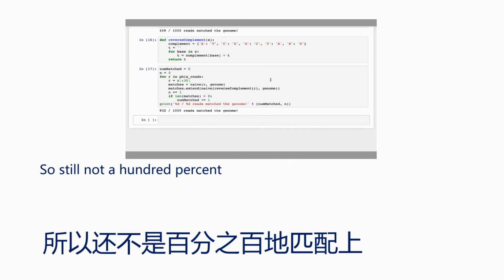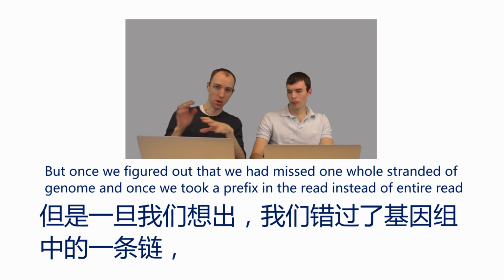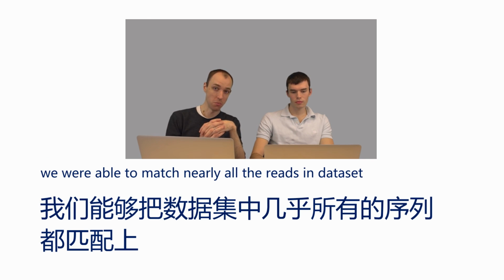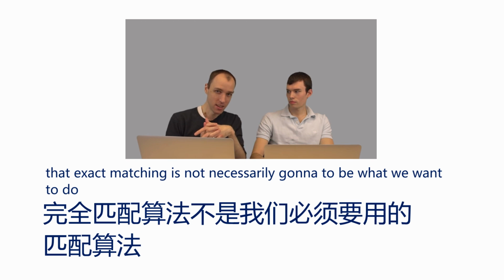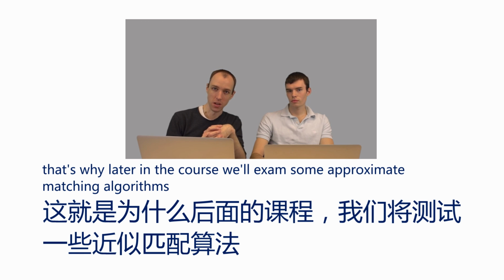Yeah, so still not 100%, but this is to be expected because of sequencing errors and things like that. But once we figured out that we had missed one whole strand of the genome, and once we took a prefix of the read instead of the entire read, we were able to match nearly all the reads in our data set. But the fact that we had to take the first 30 base pairs or so is a pretty good indication that exact matching is not necessarily going to be what we want to do, right? We want to allow for sequencing errors. We want to allow for differences between individuals. So that's why later in the course we'll examine some approximate matching algorithms.